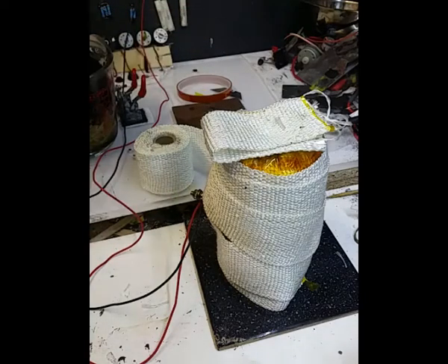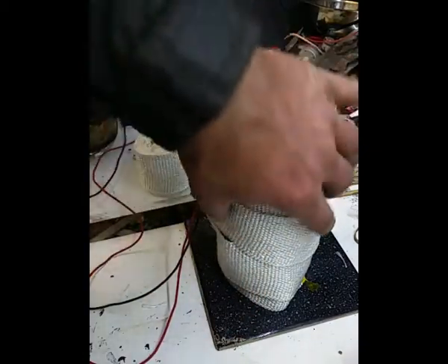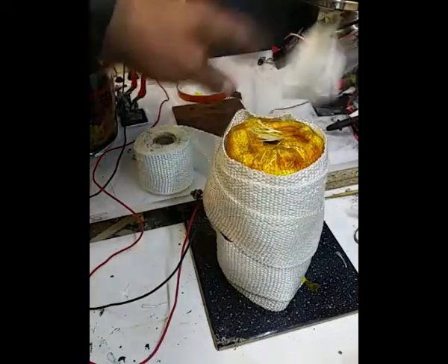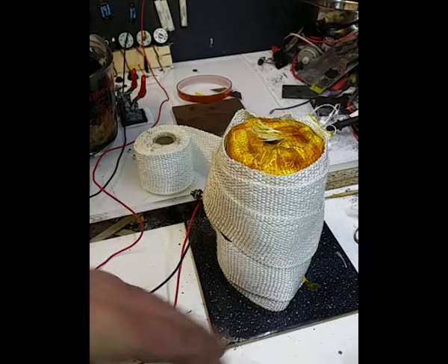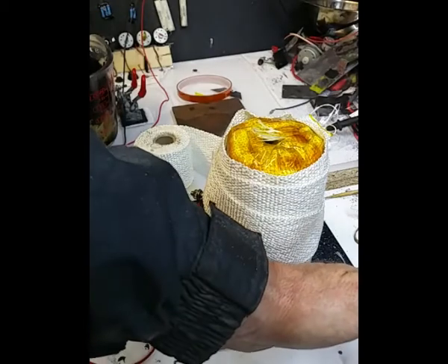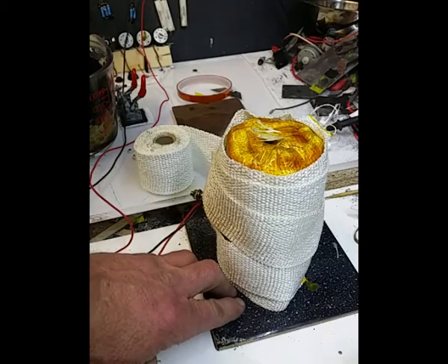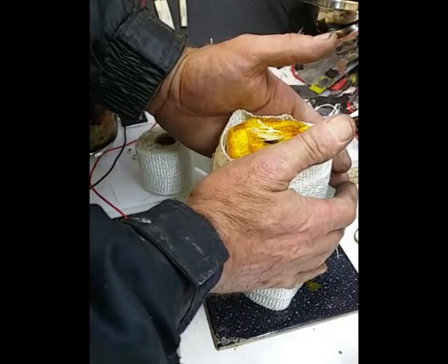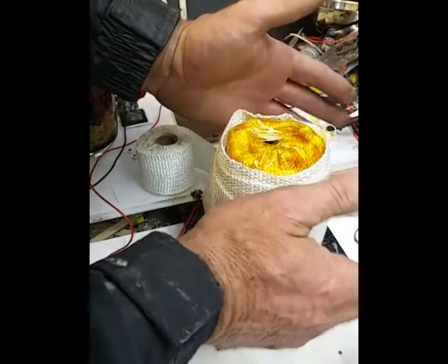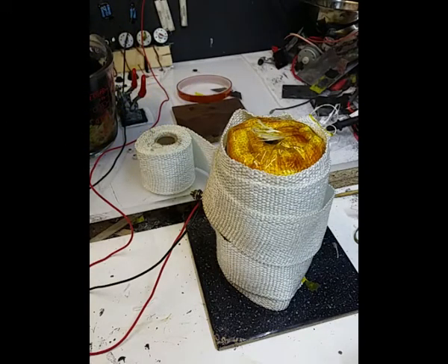So I'll just go back to the drawing board a little bit and try and build a better thermal jacket than what we've actually got here. So yeah, okay. As a concept, it kind of works. The tile's not hot, it's barely warm in fact, so the thermal jacket on the bottom's working as well. I mean, that's, you know, fairly hot, sort of warm-ish. So there you go. Not a bad idea.